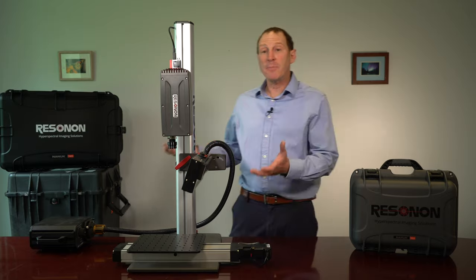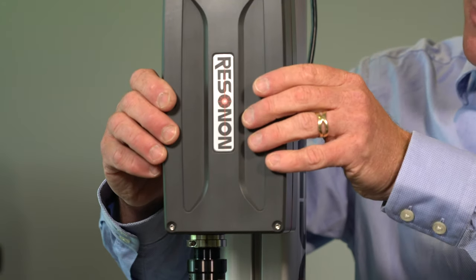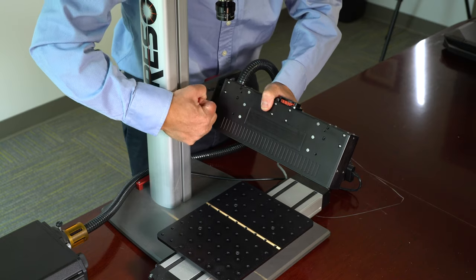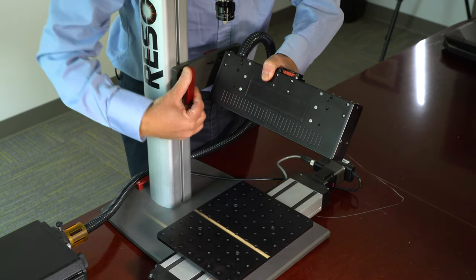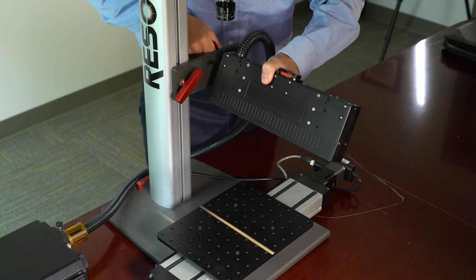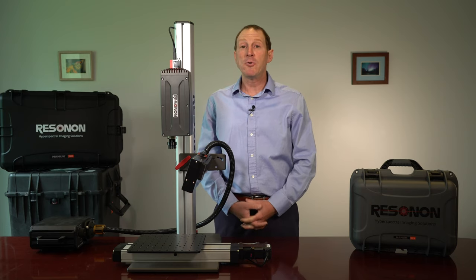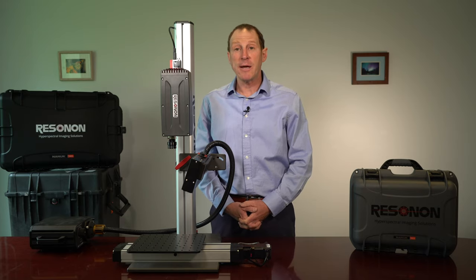Here is the benchtop system. This is the hyperspectral camera with objective lens. This is a high intensity broadband line light. This lighting is stabilized and does not fluctuate with ambient power variations, so you can be certain of obtaining high quality data.